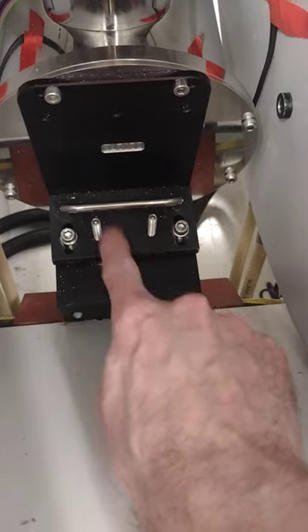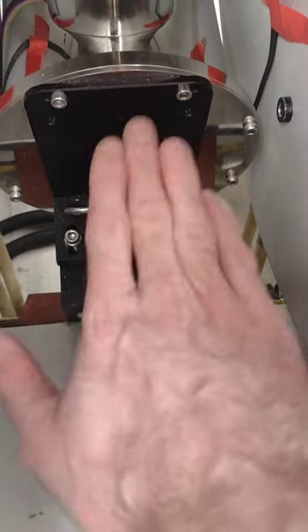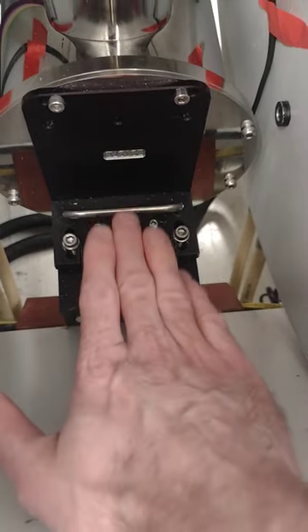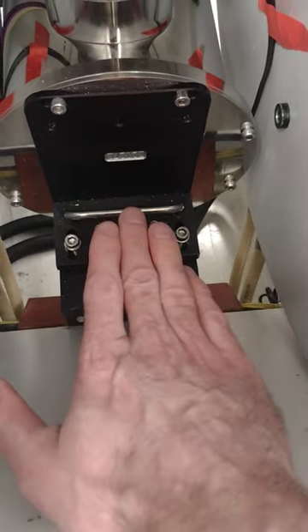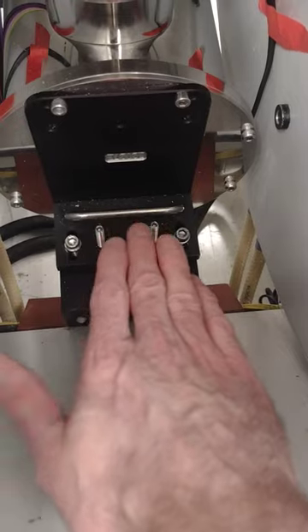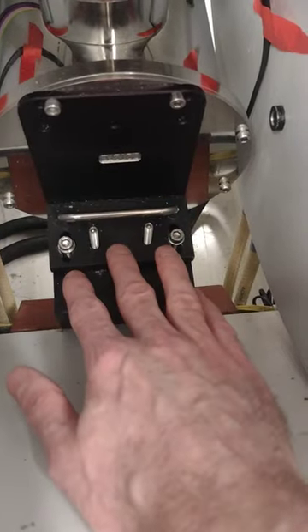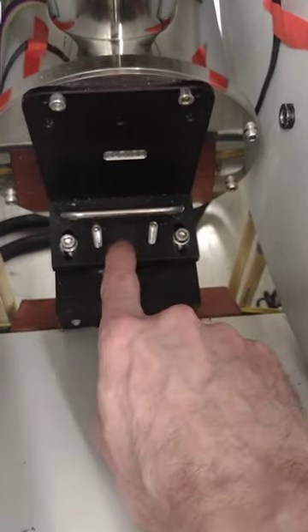These two bolts adjust the height of how the cryostat sits in the magnet, and once that's, you know, quote unquote calibrated, we don't touch those.